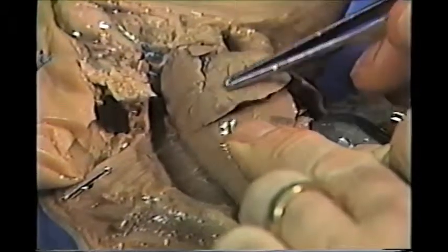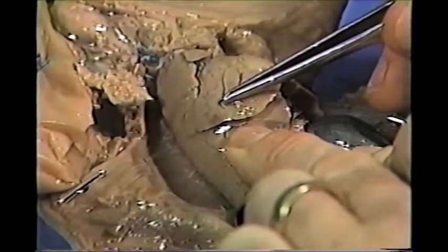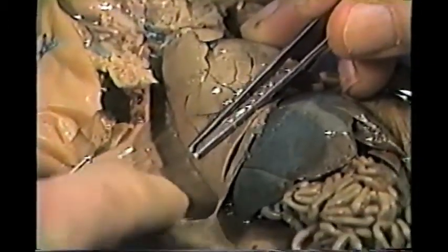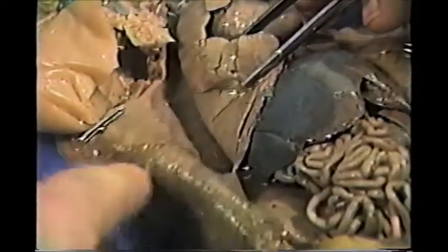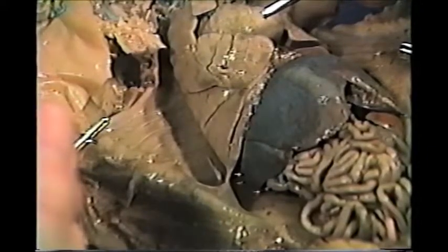Notice the shiny surface over the lung. This is a moist membrane called the visceral pleura. And there is another moist membrane on the inside wall here of the chest or thorax. That's called the parietal pleura. And these 2 pleura rub against each other when the lungs inflate. And you've probably heard of the term pleurisy or pleuritis, and that is an inflammation of either of these, the parietal pleura or the visceral pleura.